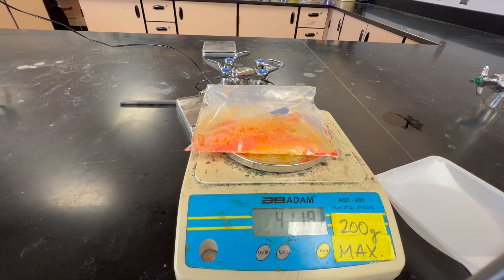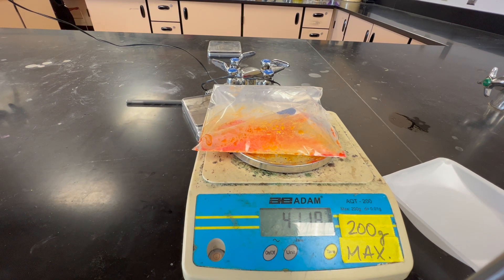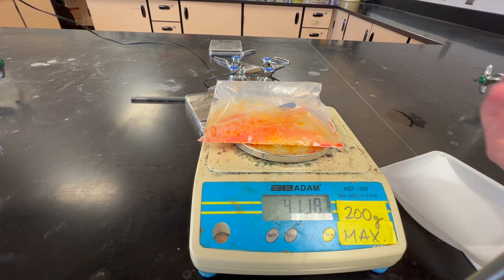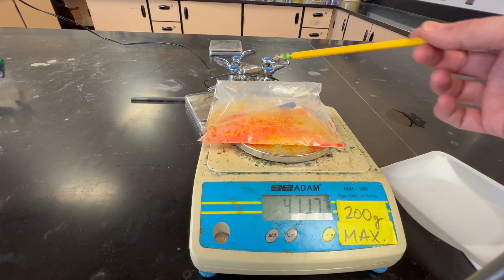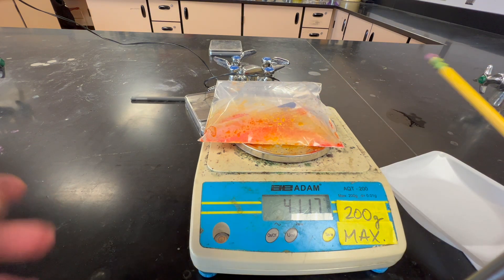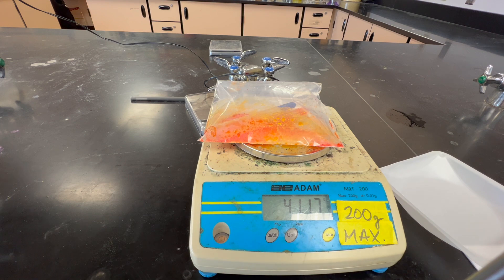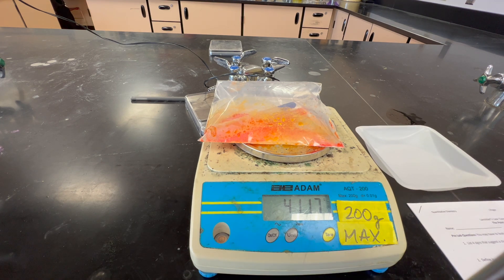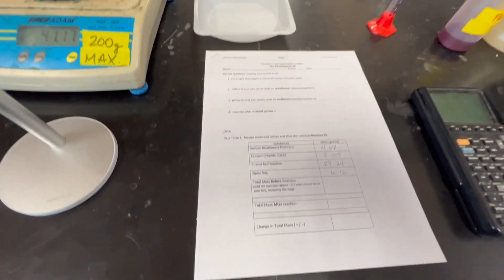After three minutes, we measure the weight of the whole system — the weight of the bag, the test tube, the phenol red, and the two powders, which have now reacted. And so we get 41.17. All of this information is going to go in our data table.